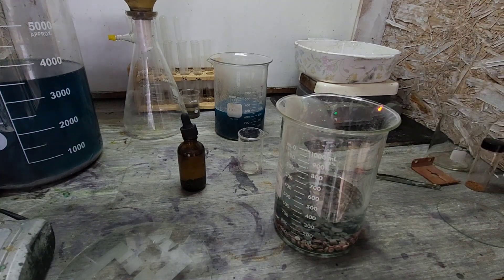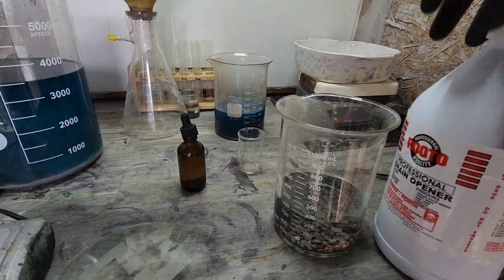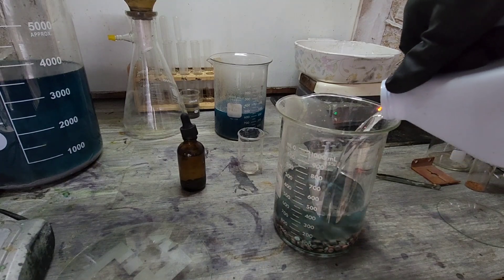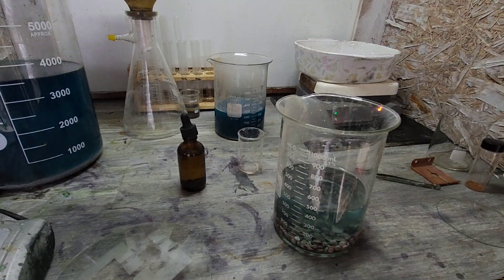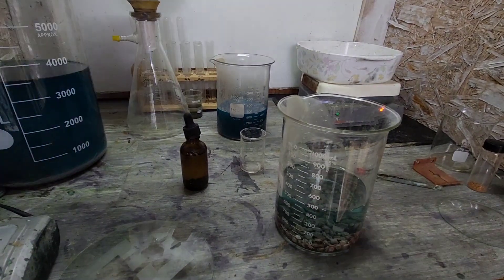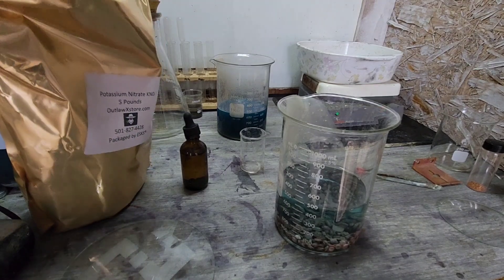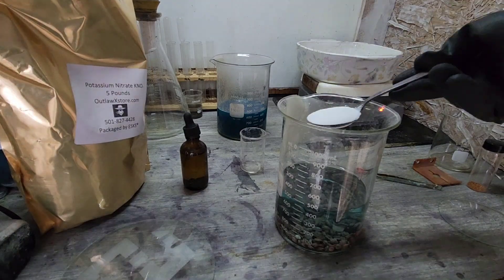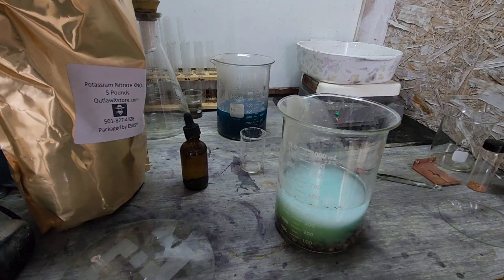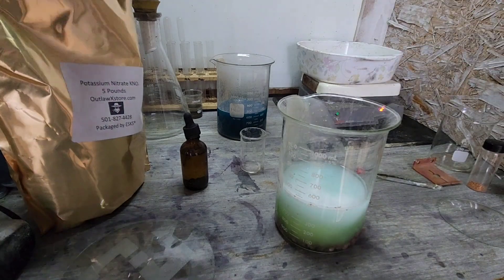400 mils of water. Running out of sulfuric — we may have to get a little bit more. 100 mils. And potassium nitrate — one scoop, two scoops. We'll let that go.